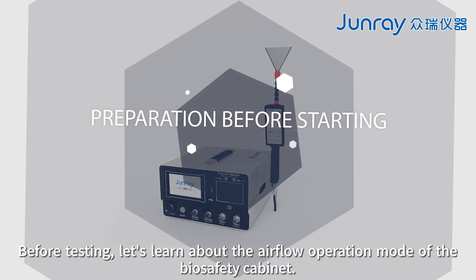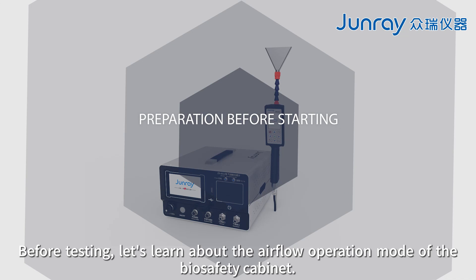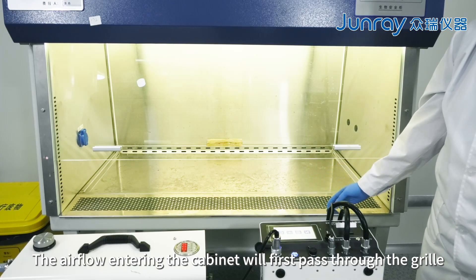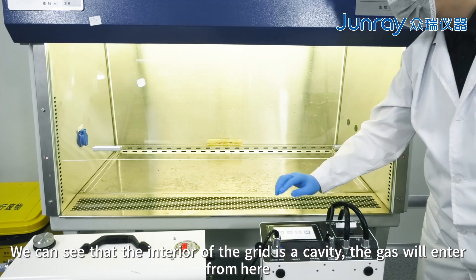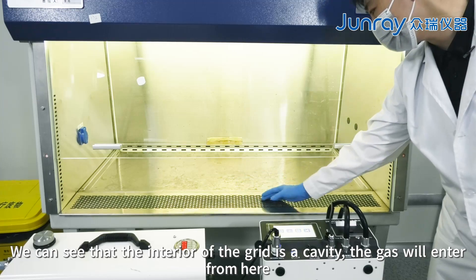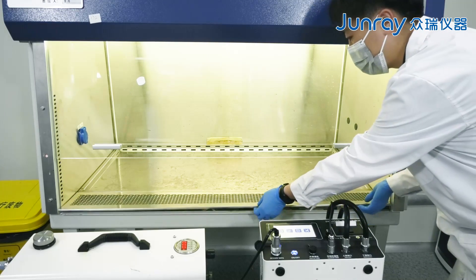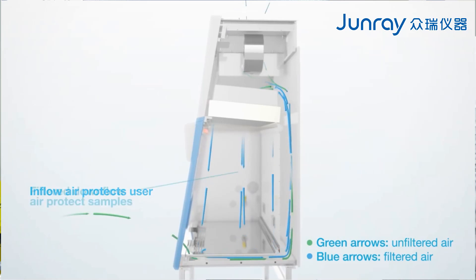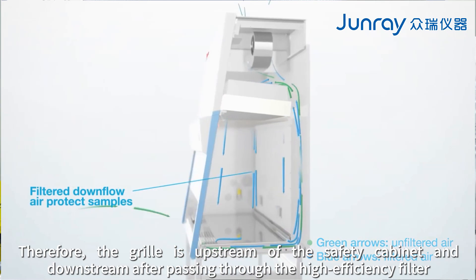Before testing, let's learn about the airflow operation mode of the biosafety cabinet. The airflow entering the cabinet will first pass through the grill. We can see that the interior of the grill is a cavity — the gas will enter from here, then flow under the workbench, and then flow down from the high efficiency filter above. Therefore, the grill is upstream of the safety cabinet.